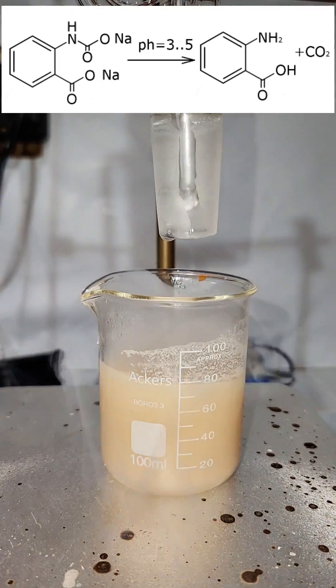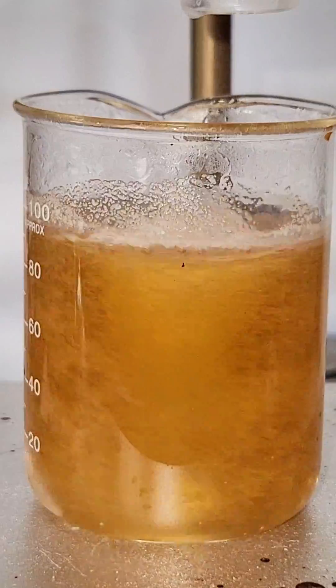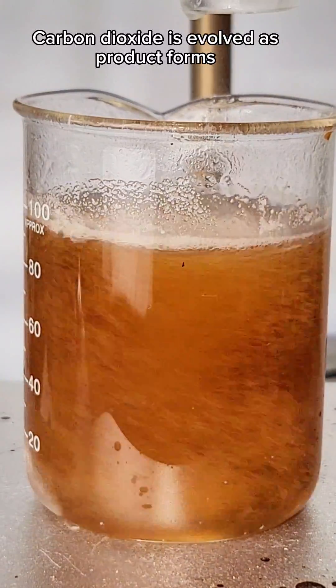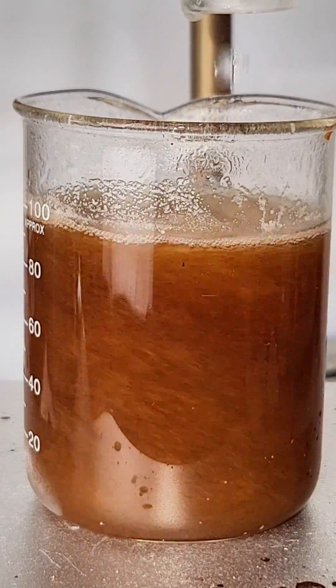However keep in mind most of this addition is the neutralization of excess sodium hydroxide so when the reaction does happen it happens very quickly and can produce a lot of CO2 gas that might bubble out of control. This is what happened to me and thank god it didn't make too much of a mess.